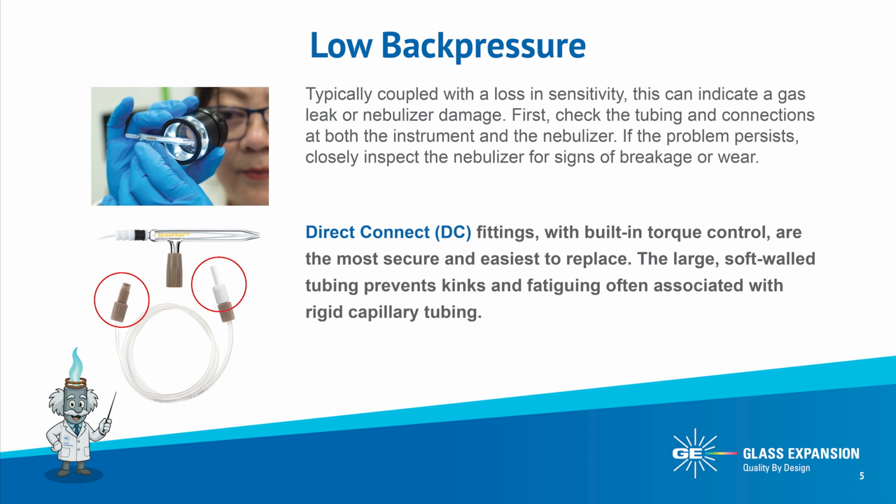Glass expansion's direct connect, or DC, gas fittings are designed with built-in torque control for a secure, reliable seal. We also use large, soft-walled gas tubing to avoid kinks or wear, which is typically associated with rigid capillary tubing. If all the connections are tight and secure, you should then inspect your nebulizer for any damage or wear. It is easier to carefully inspect the nebulizer tip with a magnifier, such as our magnifier inspection tool.